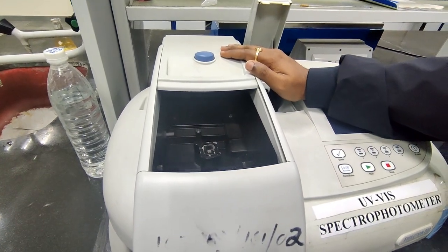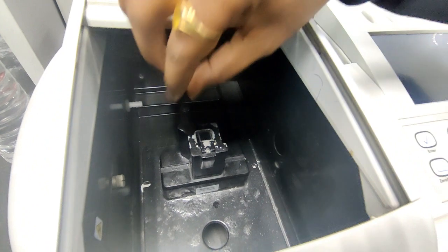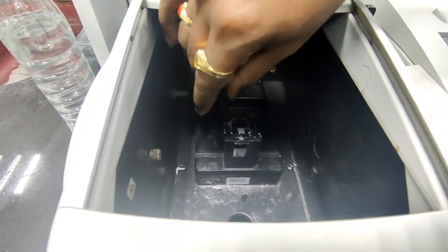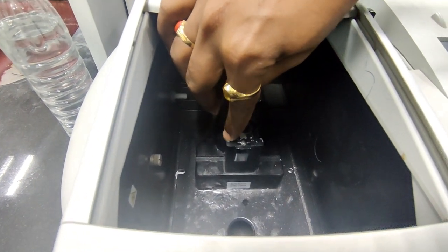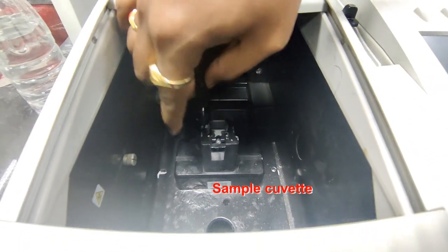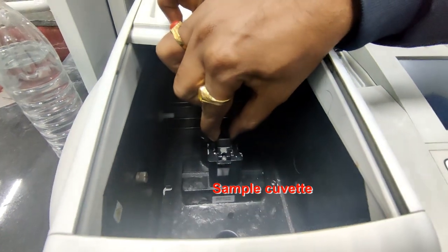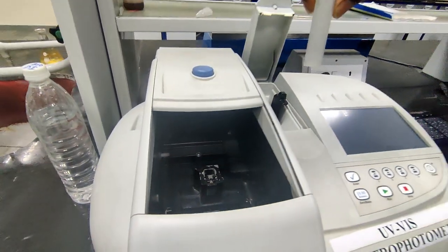And here we have a small knob. Whenever you are using it, be careful: hold one finger like this and press this knob. Now you can see that the cuvette is coming upwards. Then hold the cuvette and gently take it out from the sample holder.